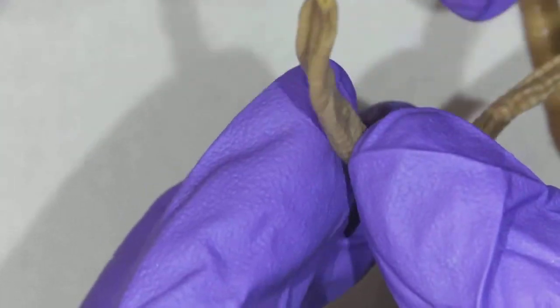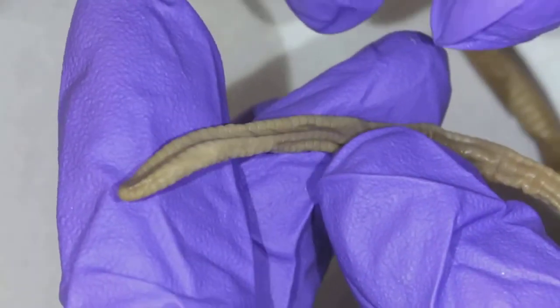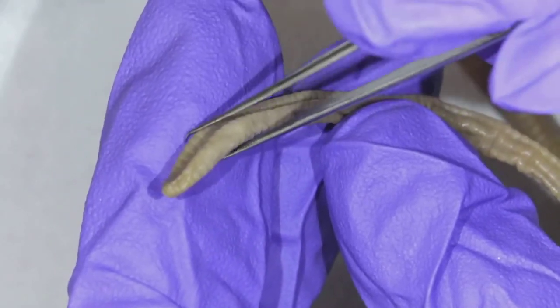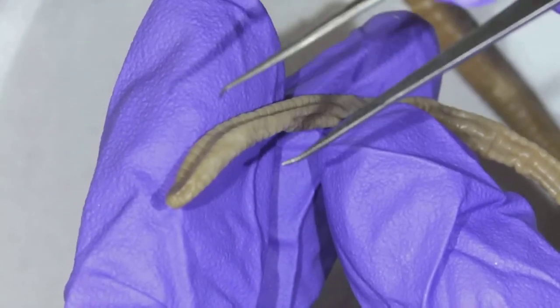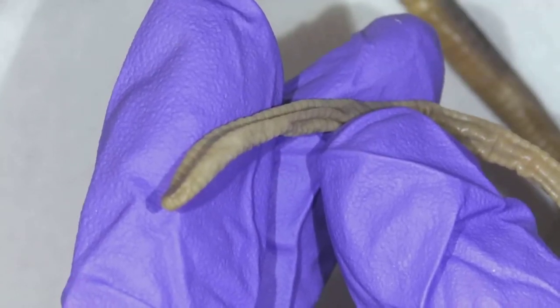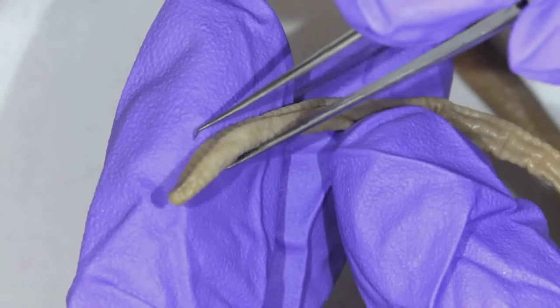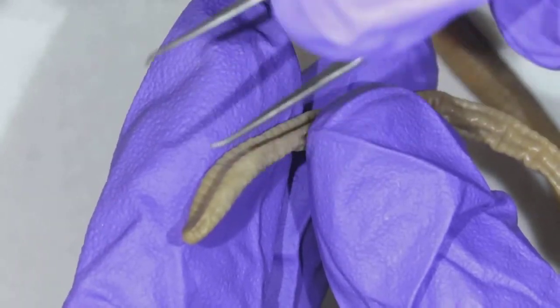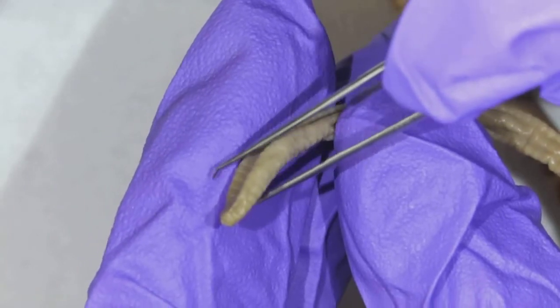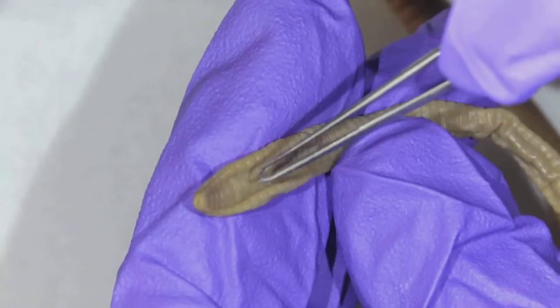All right, speaking of the other end, now I know it's a preserved worm, but it is flatter on the posterior end than the anterior end. So be aware of that. Just take a look at it. And again, a live worm is really what you want to look at. But this is pretty true. So see how flat it is this way.